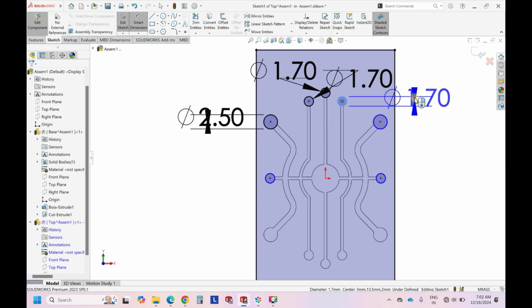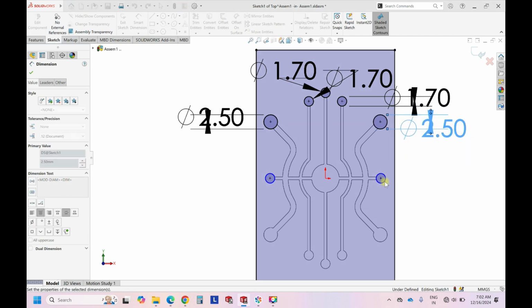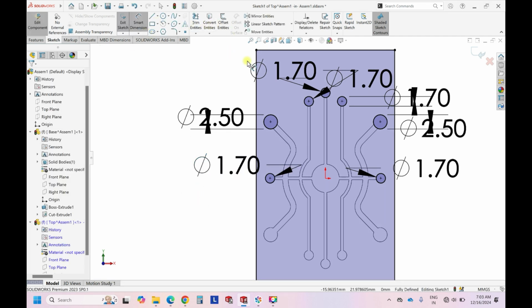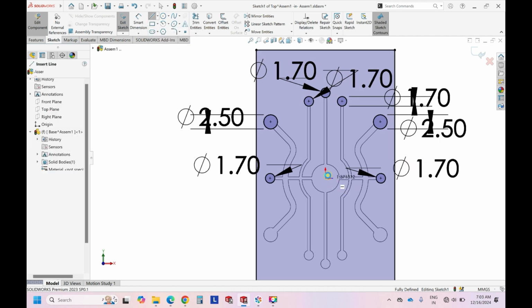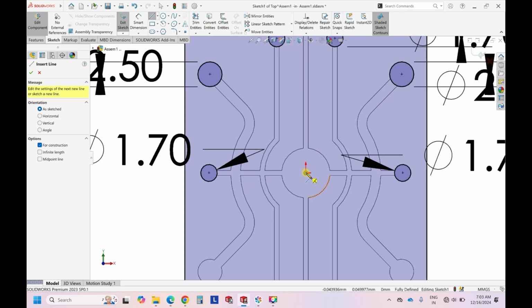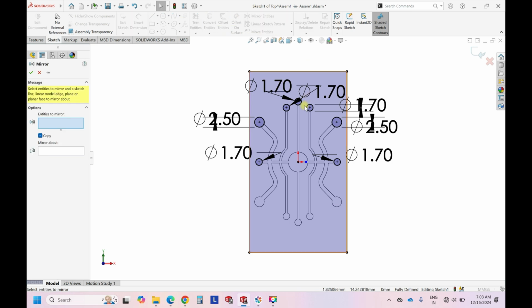Make sure the design is always fully constrained. It means that the design should not be in blue. It's a professional thing, that it should always be in black. Then we draw the center line, and then mirror all of them.